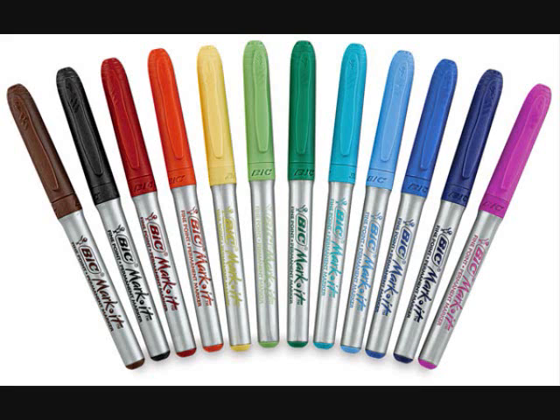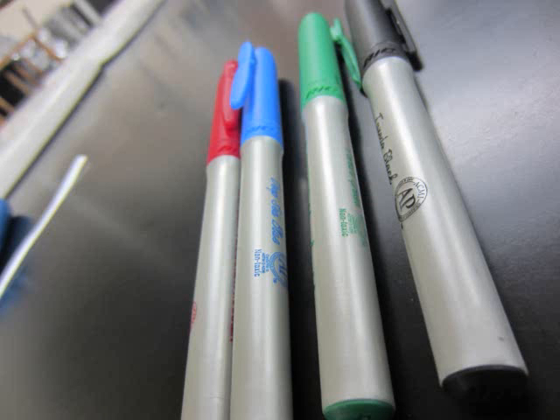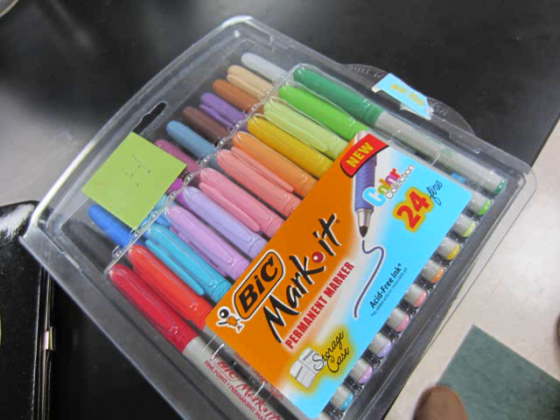Our results were that the dyes in the markers did not match the FD&C dyes because the Rf in the markers did not match the Rf of the FD&C dyes. Some of the dyes in the markers also weren't even water soluble, which all the FD&C dyes are. This disagrees with our hypothesis because we believed that the markers had FD&C approved dyes in them because it said non-toxic on the package. We also believed that there was a chance of non-FD&C approved dyes in the markers, but that was overridden by our doubt. In this lab, there were random errors and systematic errors.